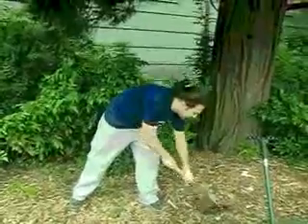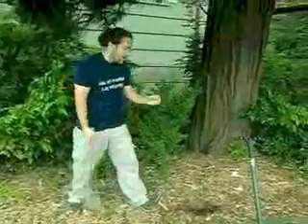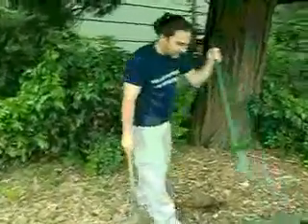Cool. So how are we going to do this? We are first going to take a shovel and clear some area right here, as you can see. That way we get the nice little soil at the top. Then you're going to take a sample of the soil at the top.